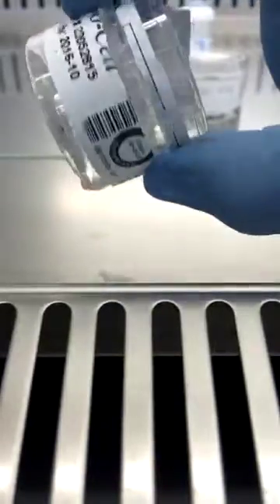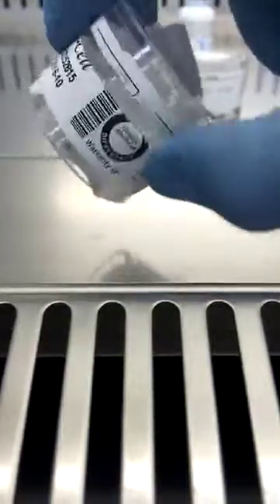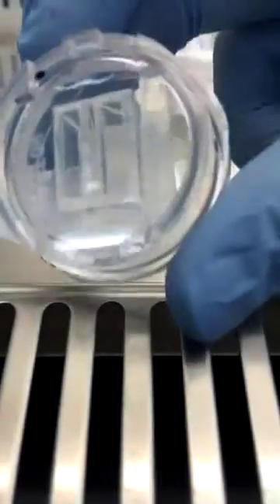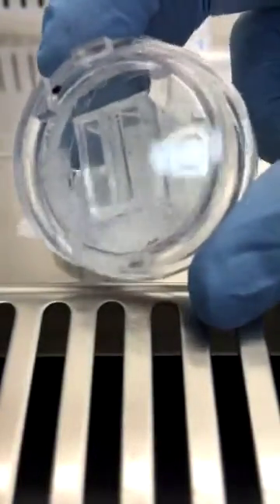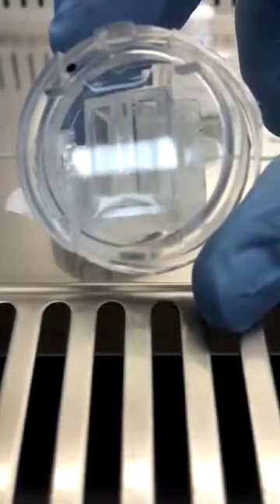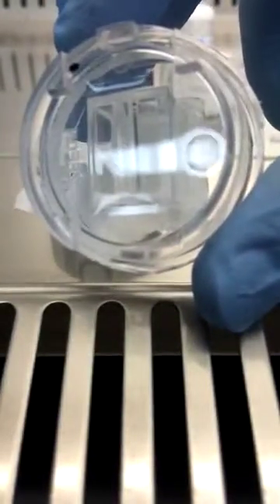Inside each one of these aerosol cassettes, once I open it up, is a cover slip, and that's the thing that shows up what's in the air.